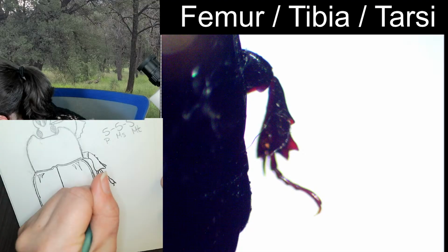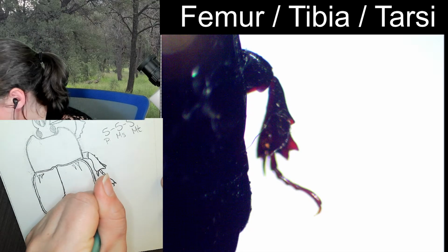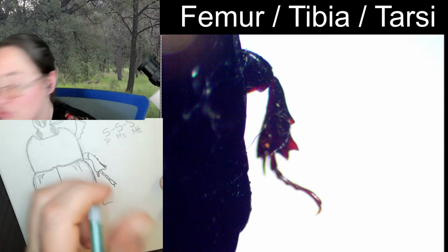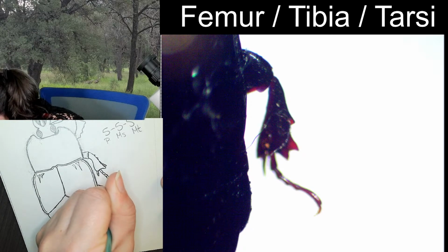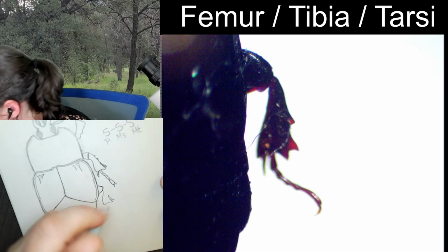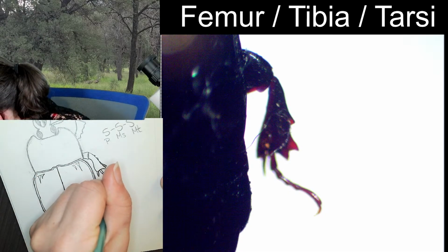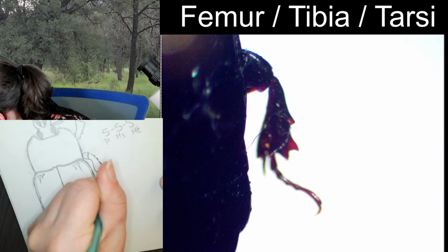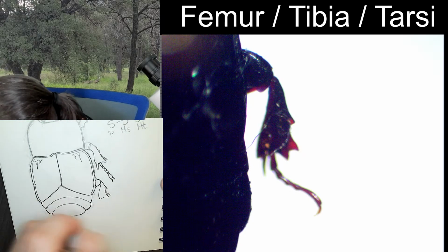The tibia has a nice smooth line along the inside. You still have that spine. We still have the two kind of spines here. And then as we go up, one significant one. Okay.